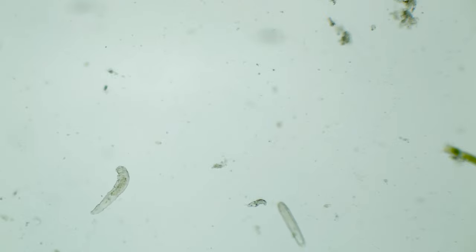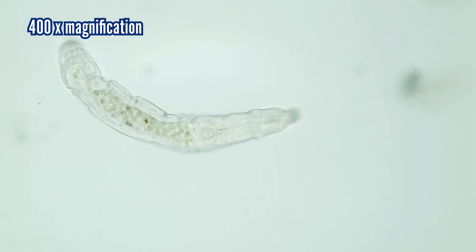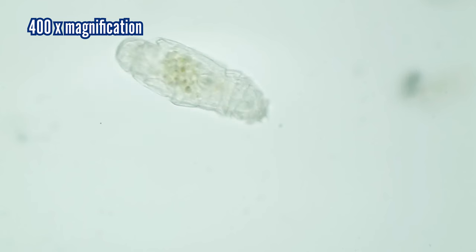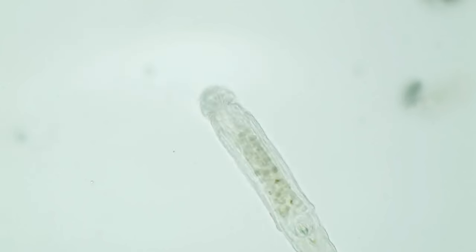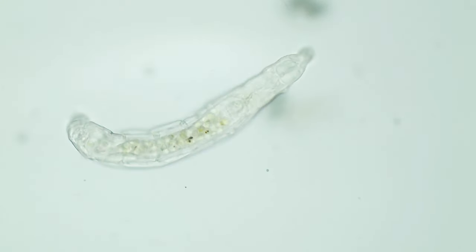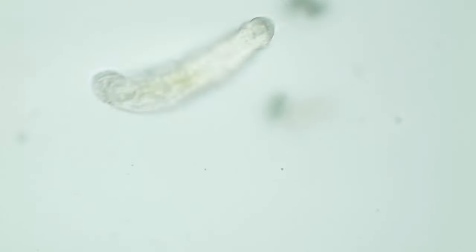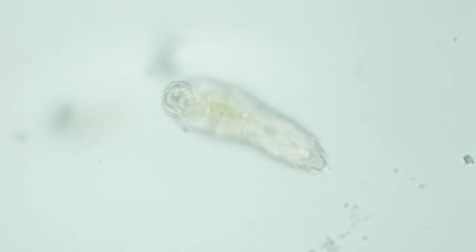No — probably wasn't attractive enough. I wonder what their criteria for attraction are. And here we can see its suckers in their full glory — this is what walking on glass looks like.